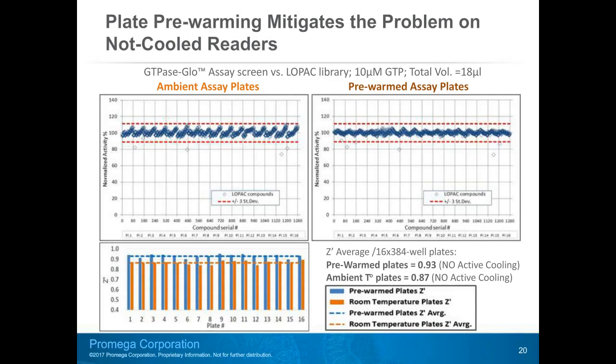All data on this slide represent measurements on a not cooled reader, the same GTPase-Glo assay. The top left graph shows data obtained from the plates measured at ambient temperature, and the top right graph shows data obtained with the plates pre-warmed in a dedicated incubator for 10 minutes each. Clearly, the top left graph screen results without pre-warming plates are already very good. The Z prime average of the plates was 0.87, indicating a very successful screen and robust assay. But pre-warming of the plates further increases the Z prime average up to 0.93.